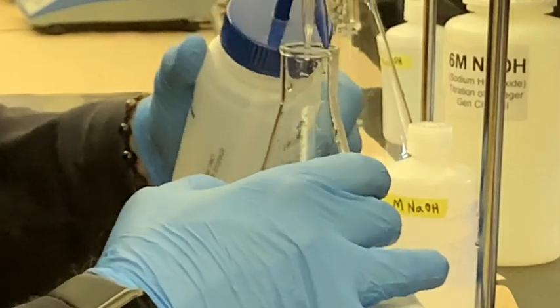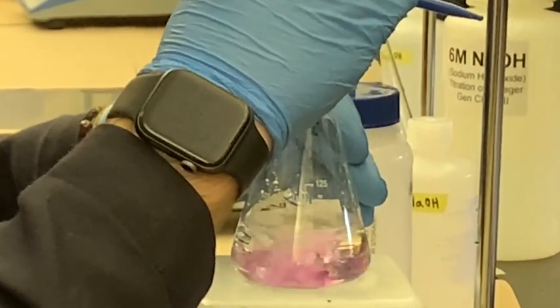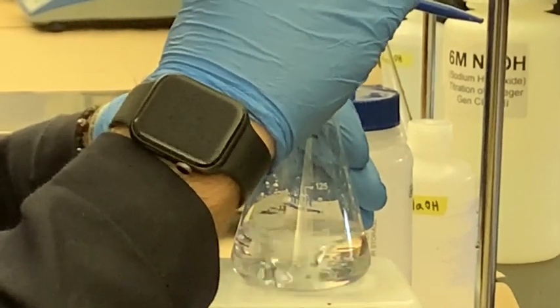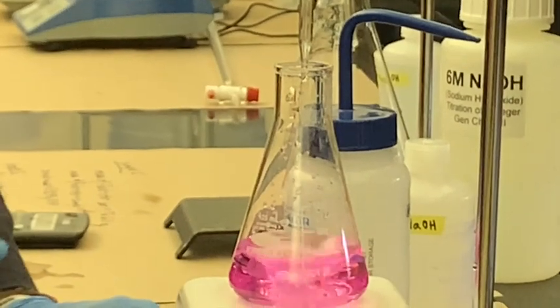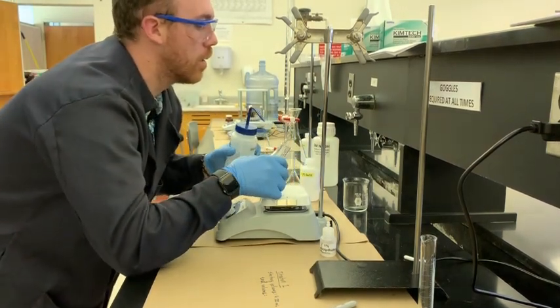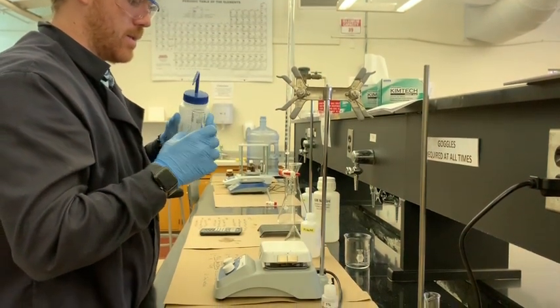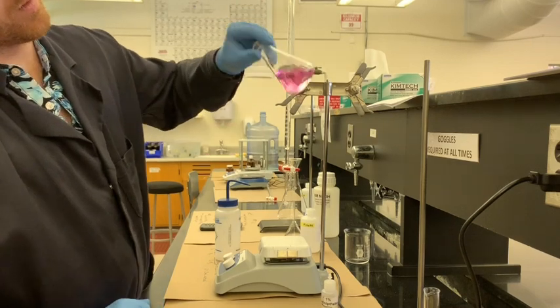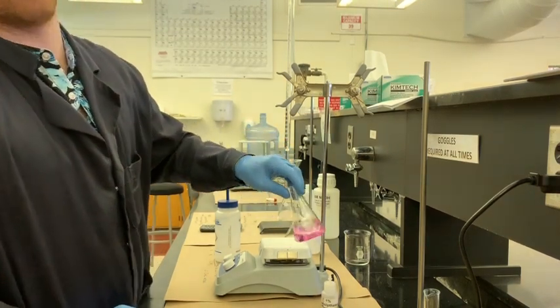Once that pink color is achieved, we'll be done. So now we're going one drop at a time. It's good to have some patience with this. You don't want a deep purple color or pink color. You want a light pink color. This is even a little bit too pink, but it gives us somewhere to start. I'm going to wash down all the solution on the sides, see where we get with that. But it happens super fast, so you want to be careful. Also, make sure your wash bottle's nice and full. This isn't ideal, it's a little bit too pink, but this is roughly what we're looking for. Lighter than this, the lighter the better.